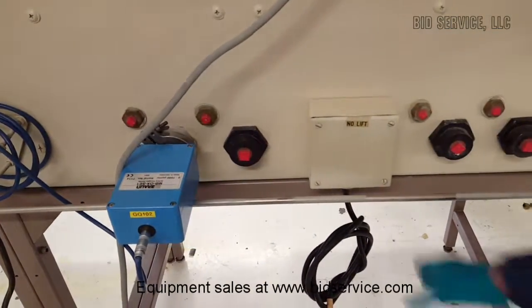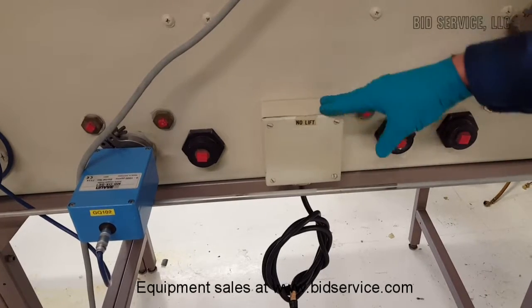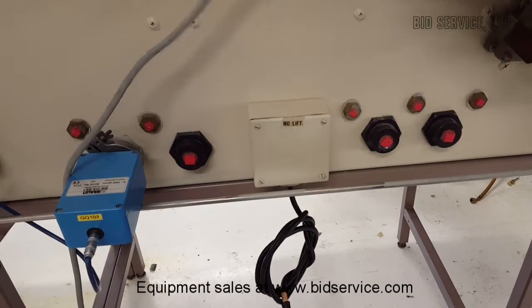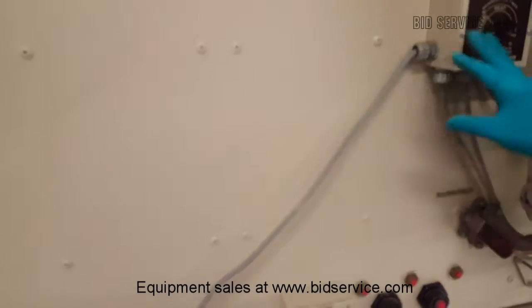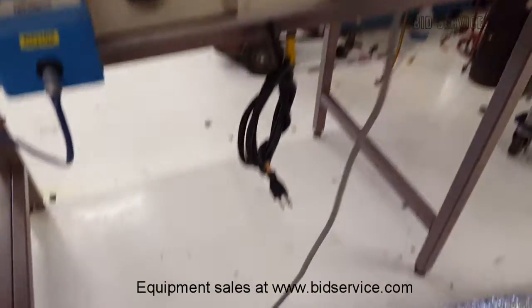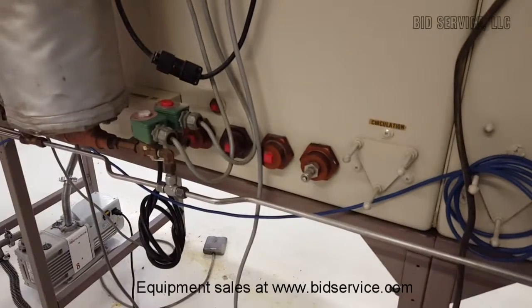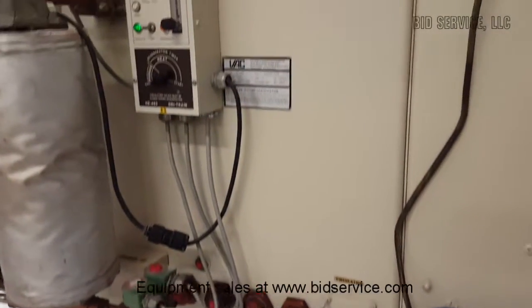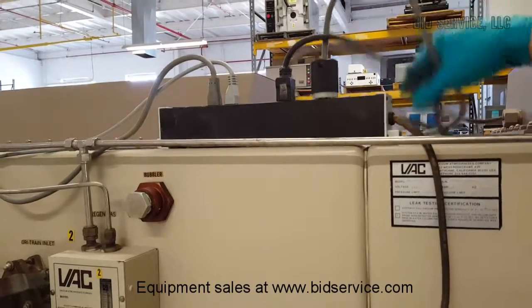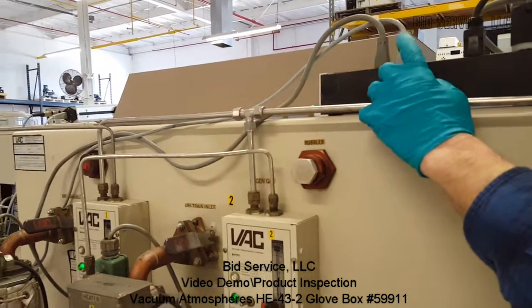You've got cords down here to bring power to your inside electrical boxes — there's one here and one on the other side. They just need to be plugged into an outlet. You also have power for your dry train here — that's 110, plugged into an outlet. So you'll need three outlets for your purifiers, plus two more 110 plugs for your internal electrical. Up top the lights are plugged in, along with the 110 for the pressure controller and the oxygen sensor.